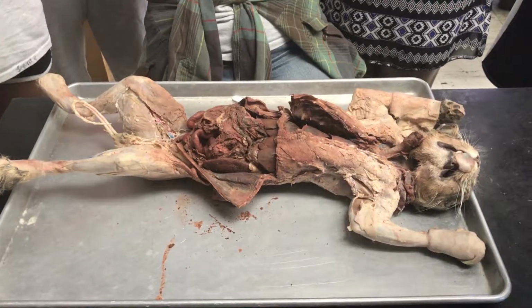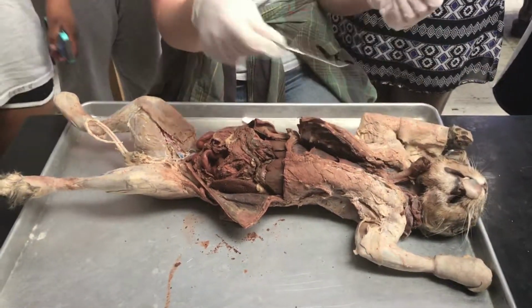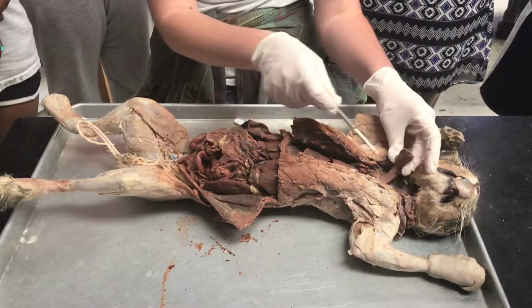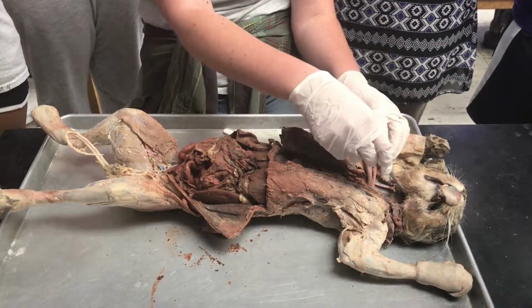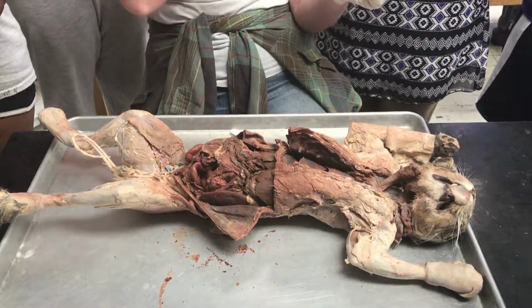Alright, so digestion begins with food ingested into the oral cavity here. When it's swallowed, it's going to become bolus and it's going to go into the pharynx. So what you have here is the larynx. The pharynx would be above that. Okay, so it's going to be in this region here. Now the pharynx is common for both the digestive tract and the respiratory tracts.